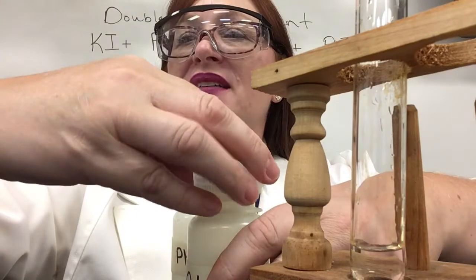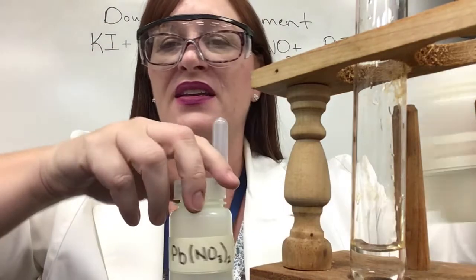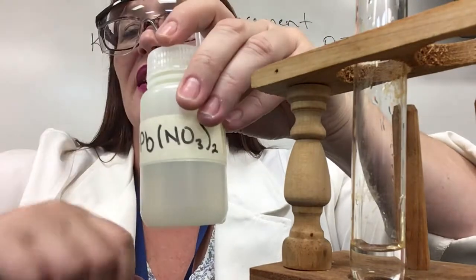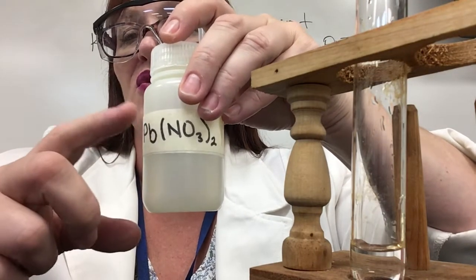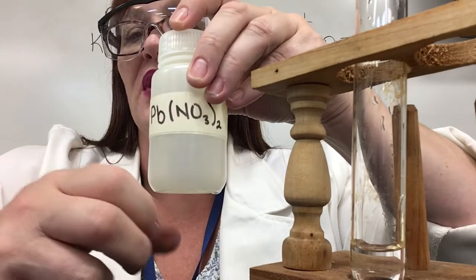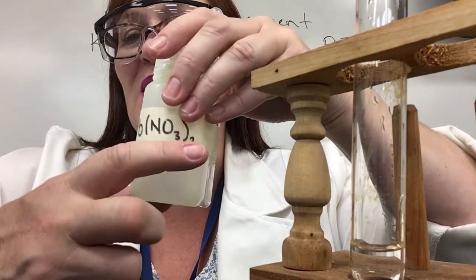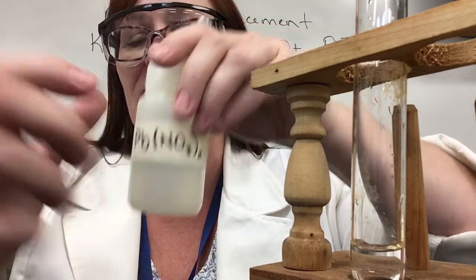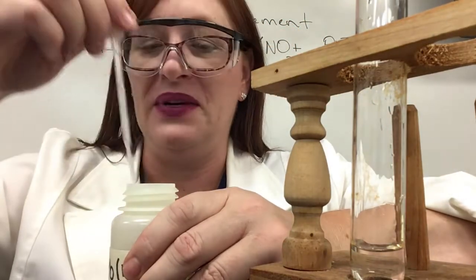My other reactant is lead nitrate. That is Pb — it has two valence electrons so it's a 2+ charge — and NO₃ which is a 1- charge. When I crisscross I have to put my parentheses around my nitrate and the two on the outside. So this is lead nitrate and again it's just a clear liquid.